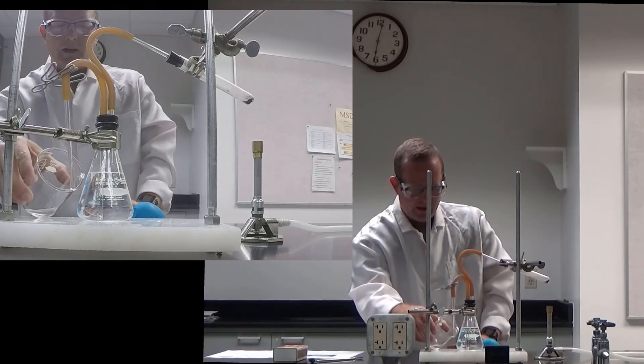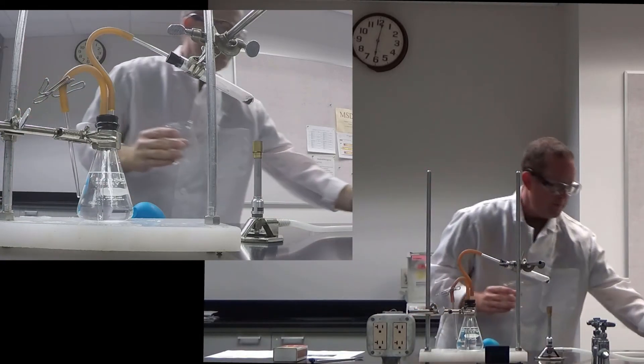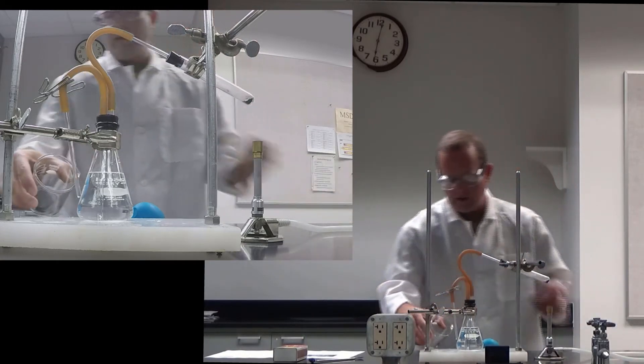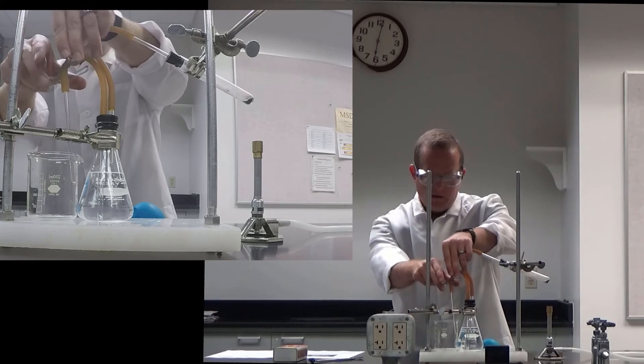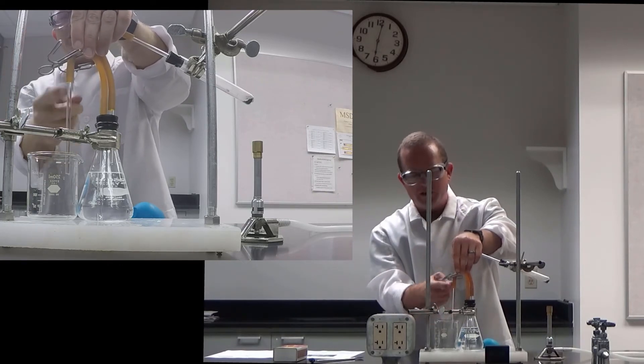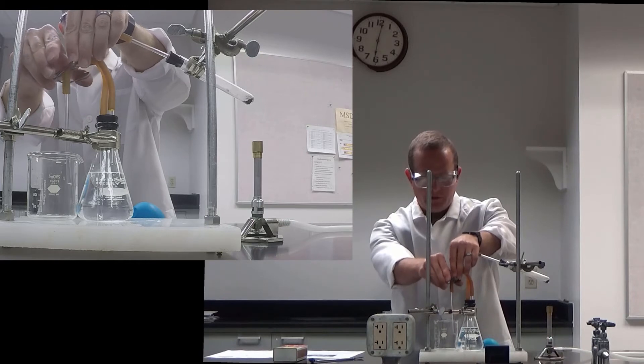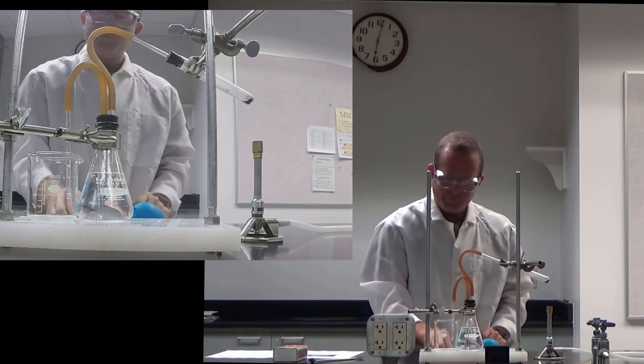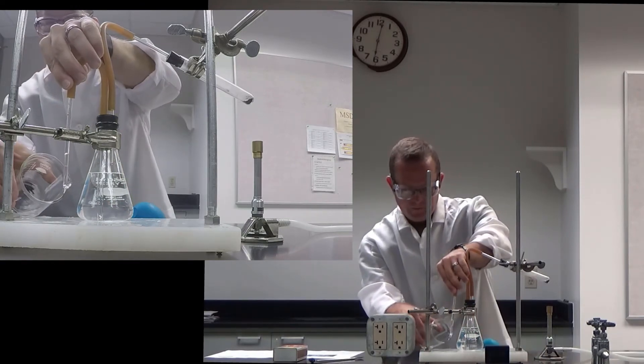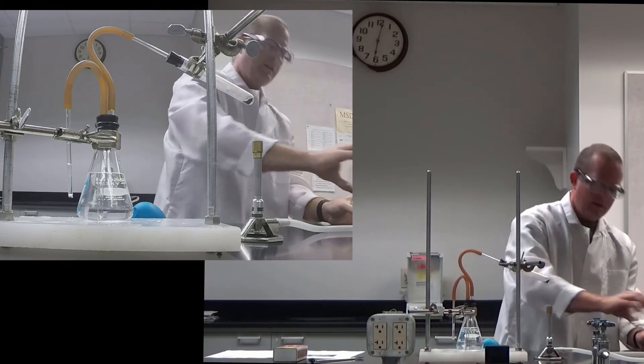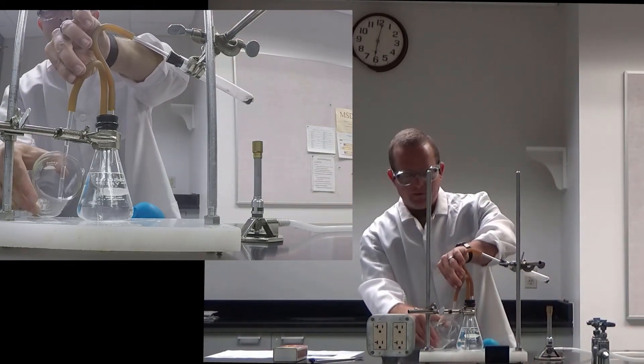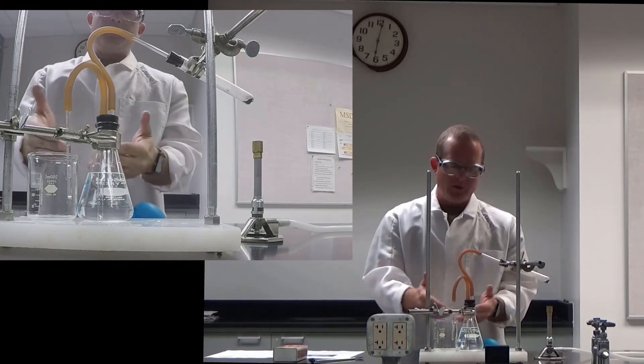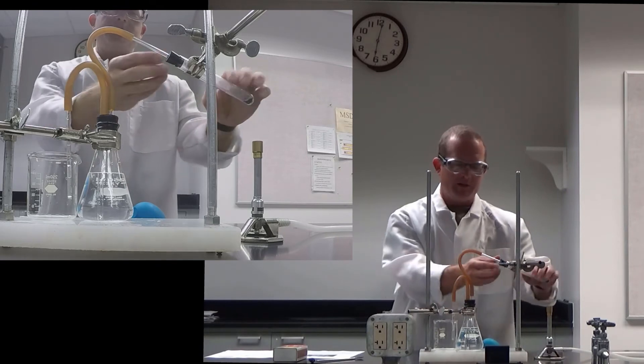OK, now I'm going to go ahead and undo this clamp. When you undo this clamp, you shouldn't see much air come back in because it should be completely sealed. OK. And I think that's still OK. So now I'm going to empty this. Now I'll take the mass of this beaker. Because all the water that will now go into this beaker will be water that has been pushed through because of the reaction generating oxygen gas.